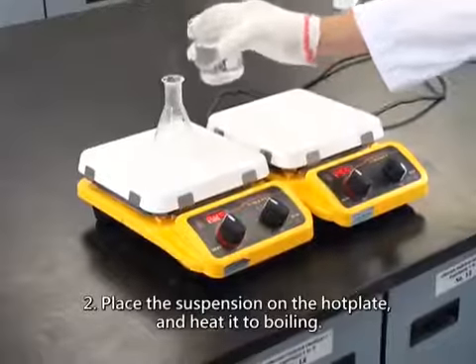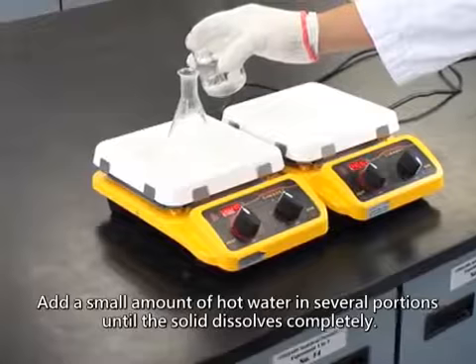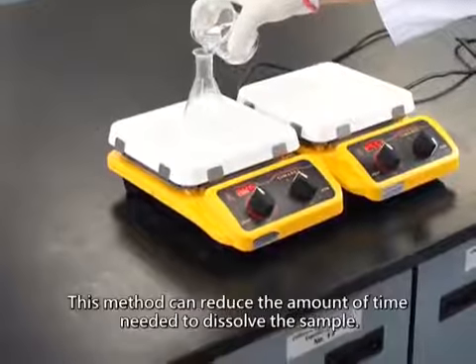Place the suspension on the hot plate and heat it to boiling. Add a small amount of hot water in several portions until the solid dissolves completely. This method can reduce the amount of time needed to dissolve the sample.